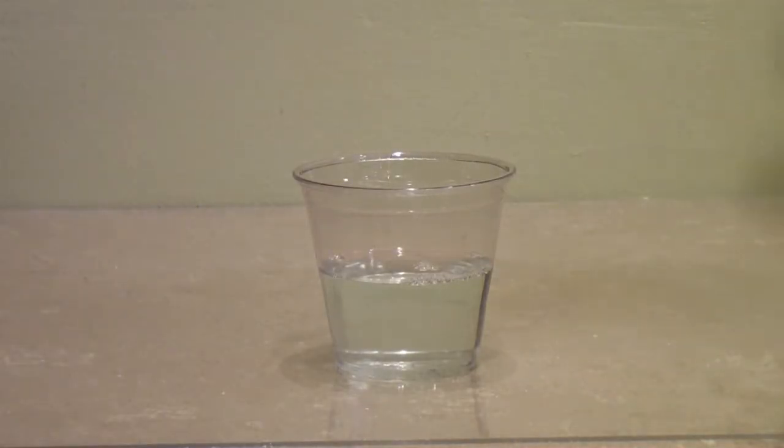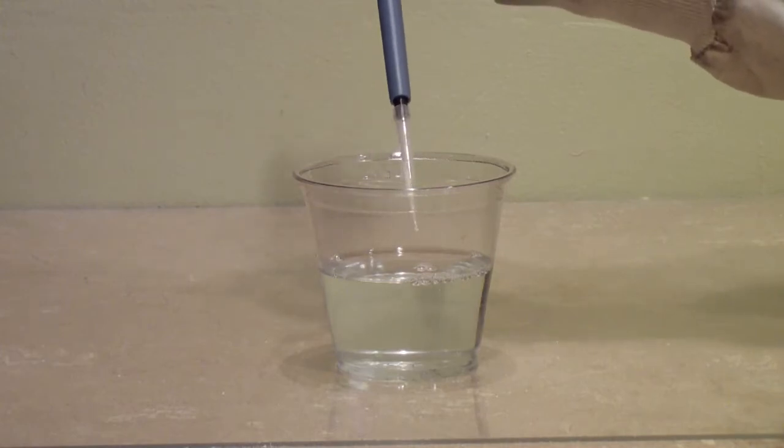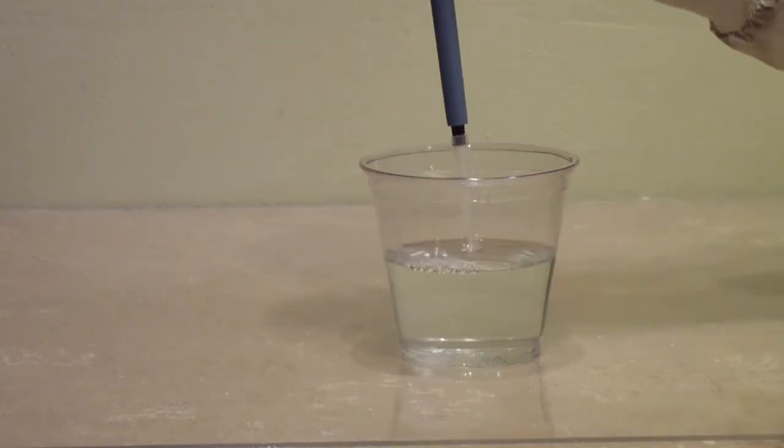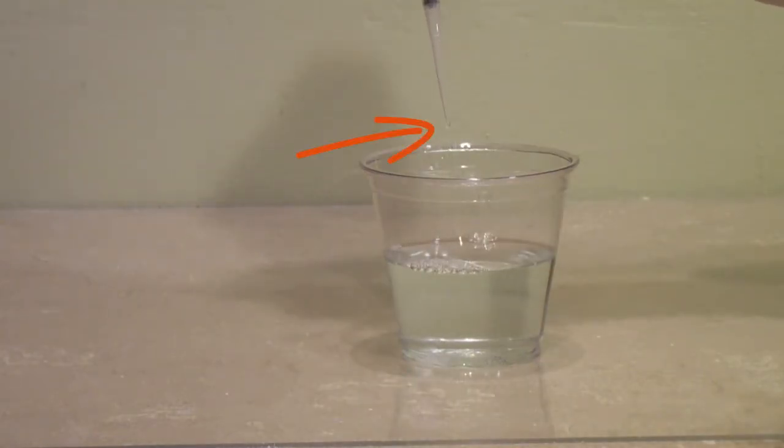When you are ready to expel the liquid, I recommend touching the tip on the inside of the container. This helps guide the liquid out of the tip, making it easier to get all the liquid out. Otherwise, the last drop may dangle from the tip and may be hard to deposit.